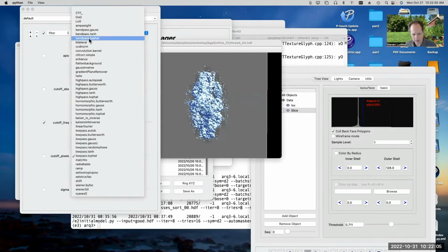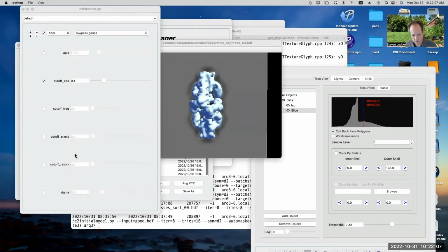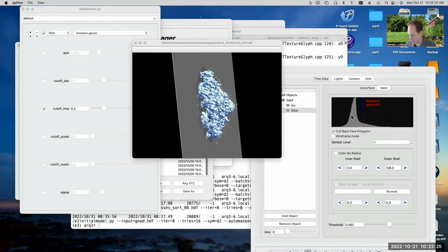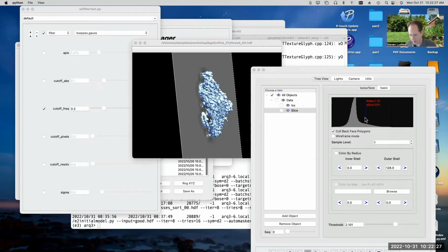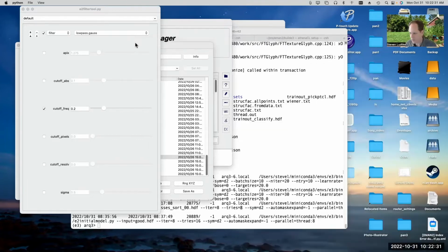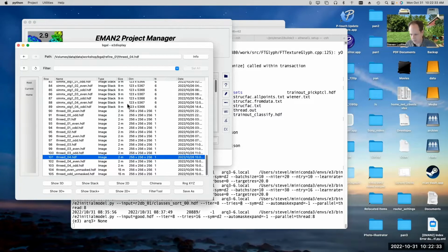If we do a Gaussian filter, and again, I've got to adjust the resolution. You can see that it's constrained locally, right? I mean, it chops off the edge of the mask. You don't see any of these funny ripples running out. It's a lot smoother in general when you use the Gaussian filter. All right. So anyway, we got some fairly nice structures out of these quick refinements that I did.